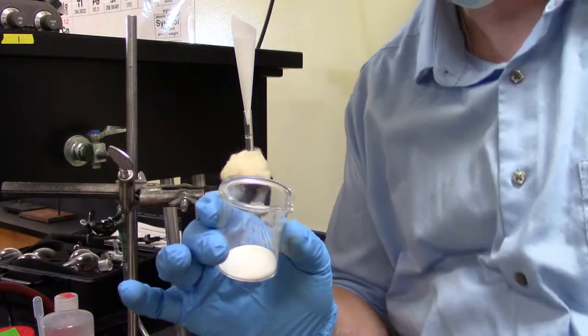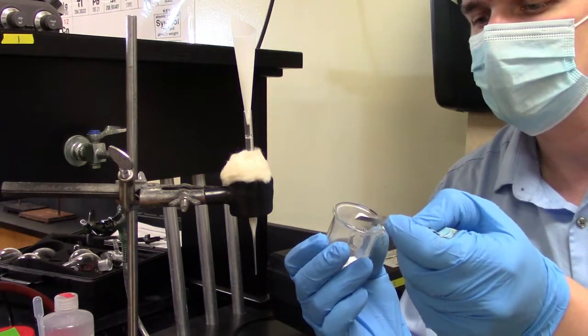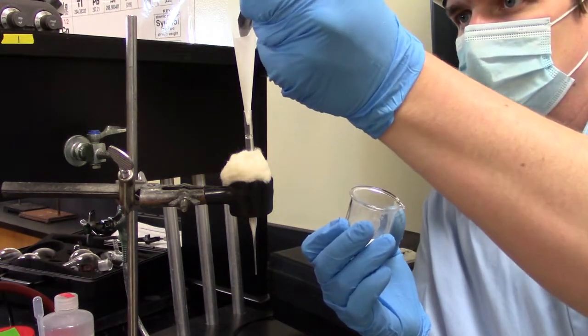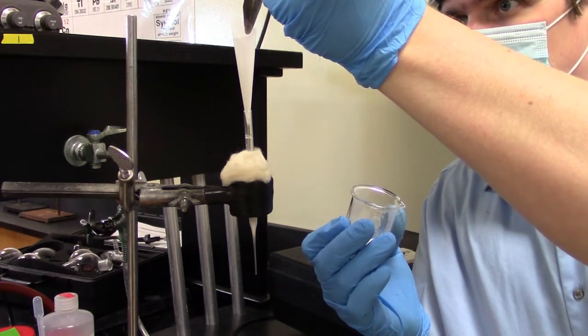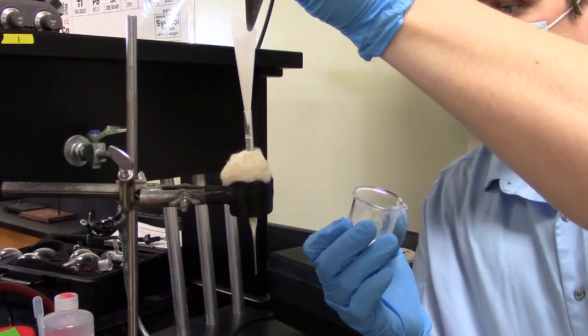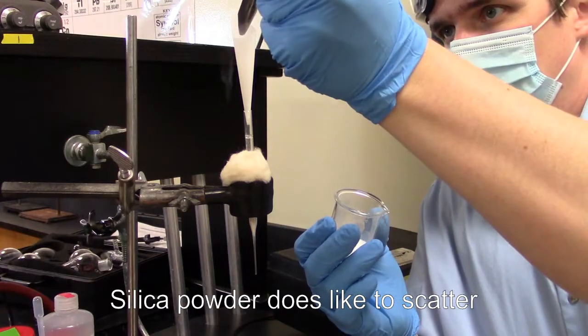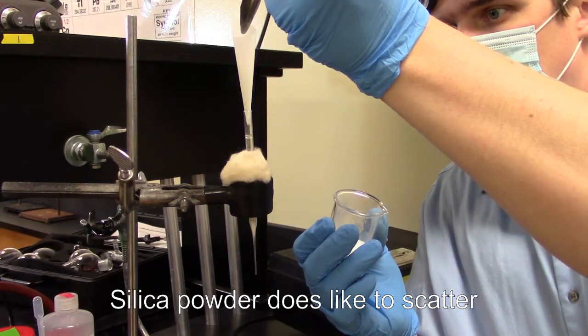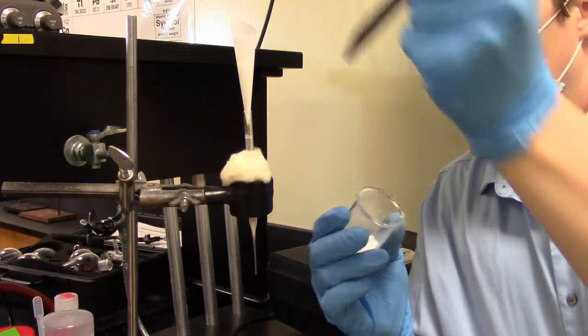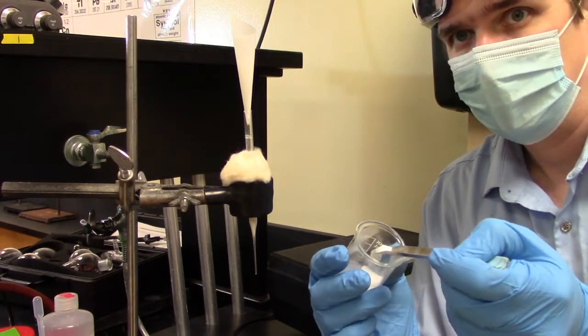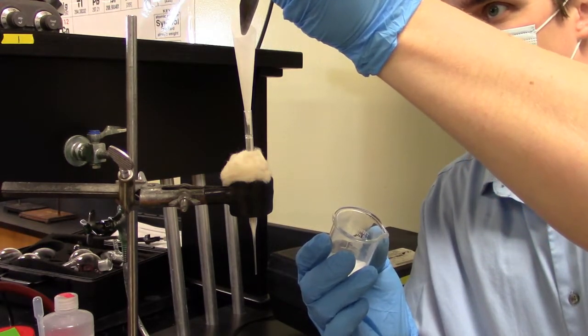Now, the silica gel is super finely dispersed. It's a very fine mesh. So it is going to try to scatter on me a little bit. And this is going to take quite a bit. Again, I'm sorry for not wearing safety goggles. It just kind of helps with making these videos.